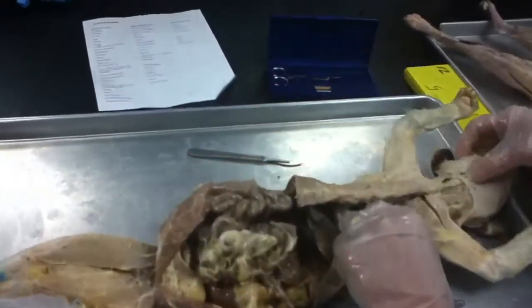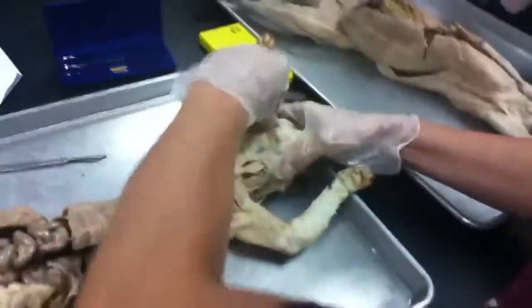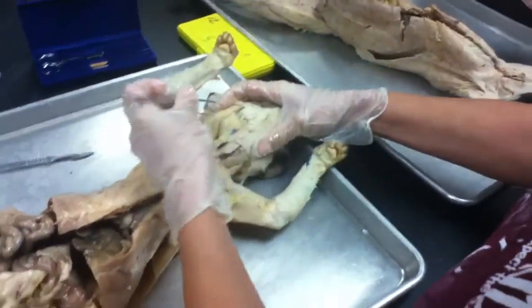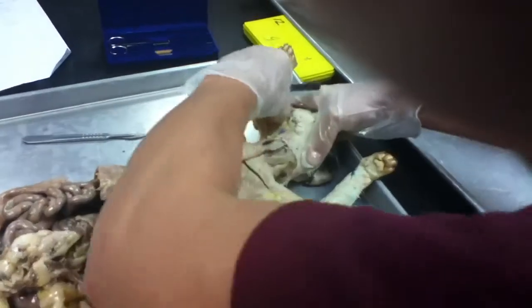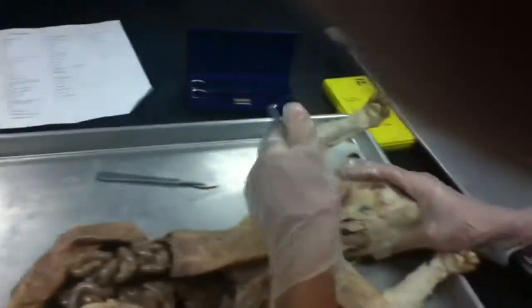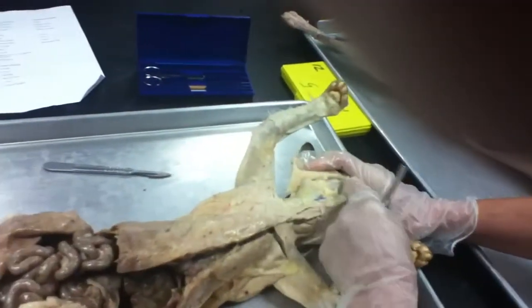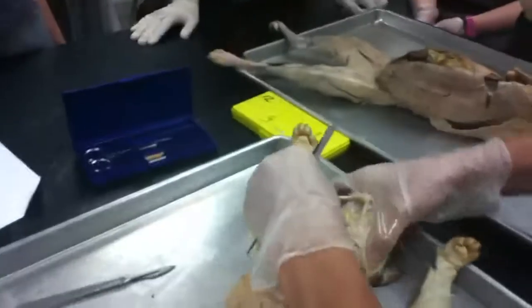The last thing for today, and should hopefully be the last three things on your list there, are the salivary glands. Now, if you found your masseter muscle when we did muscles like you were supposed to, today's going to be much easier, okay? If you didn't, you now have to still cut into the cat's face to find the salivary glands, okay? So that's why we relocated, because I wasn't going to mess with that today. So here was that big masseter muscle right here in the front, okay?